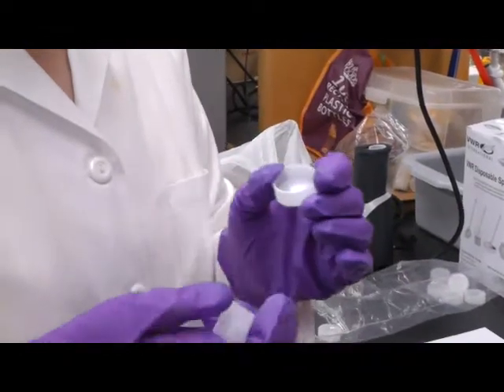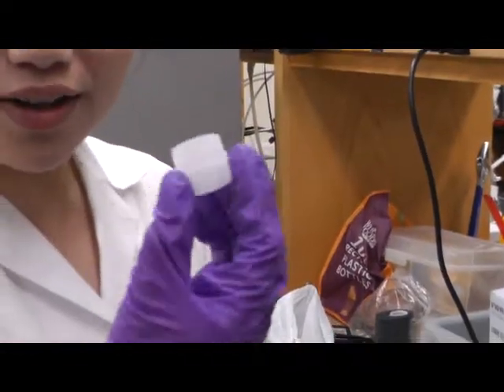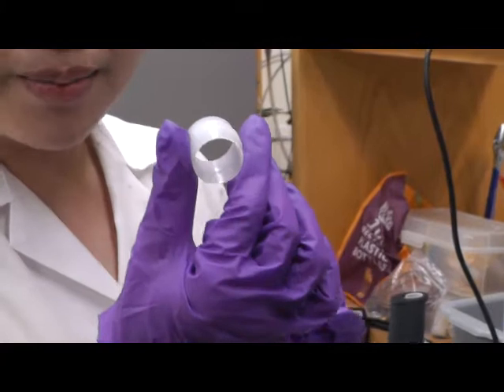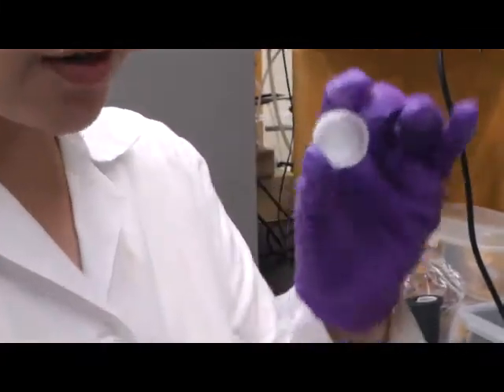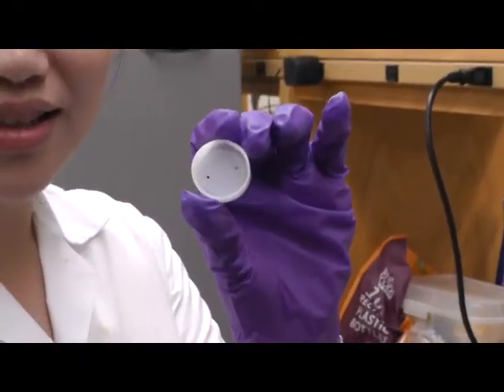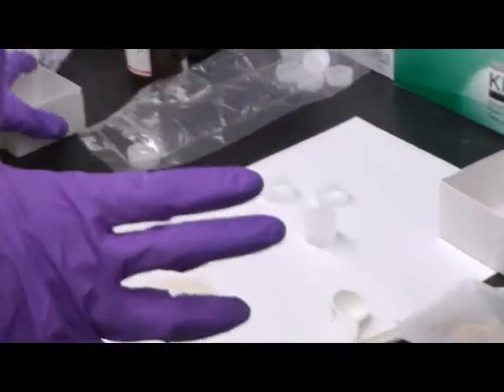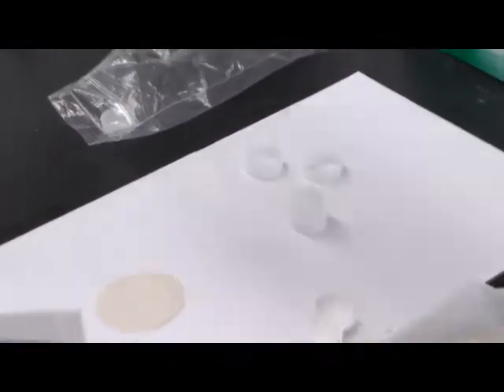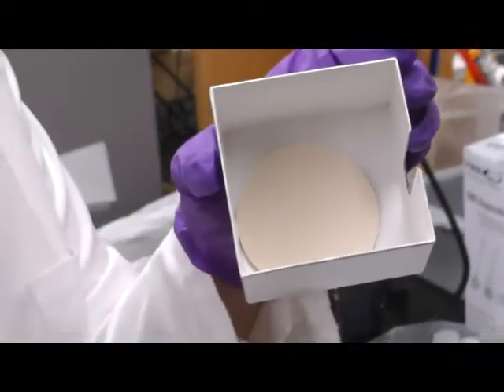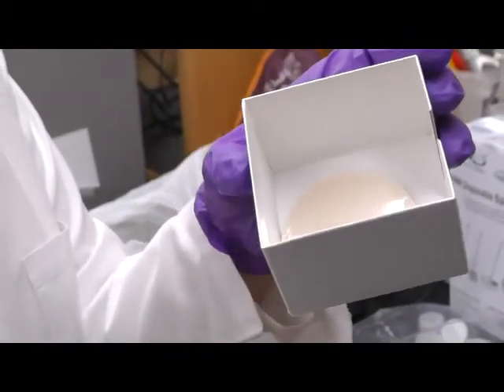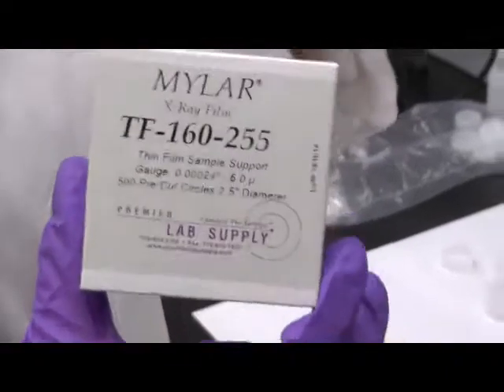And we will need a taller one, which is the middle part. And we will also need a cap, which looks like this. And we will also need an XRF thin film, which could be purchased from lab supplies.